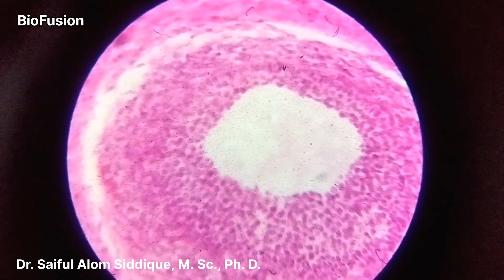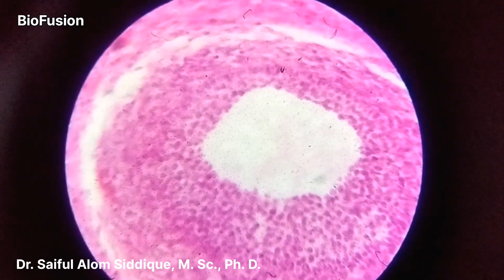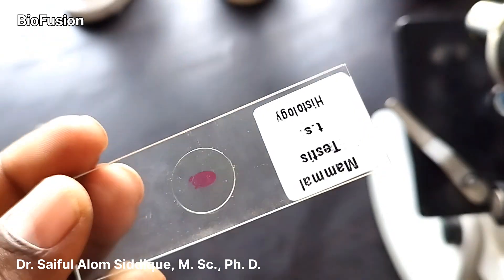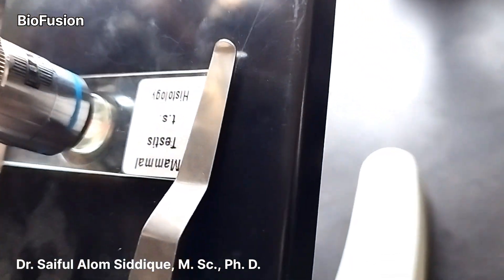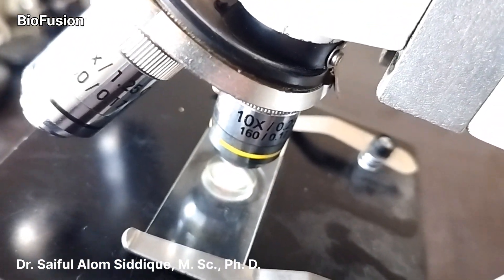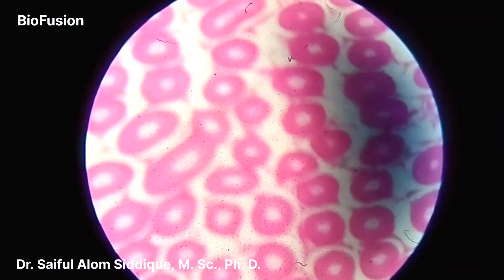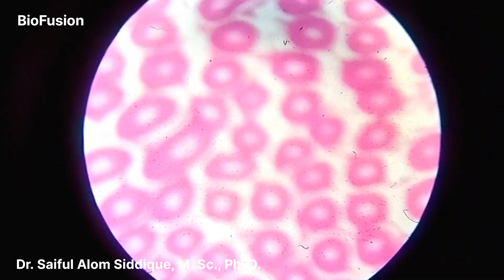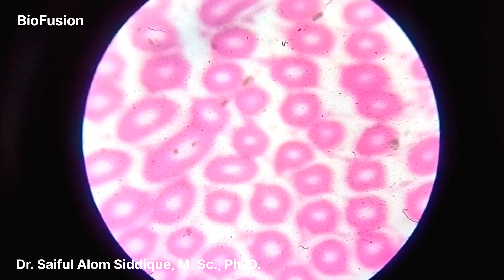The Graafian follicle — we have found a 100x view here and we can see in the first section that there are several of them.